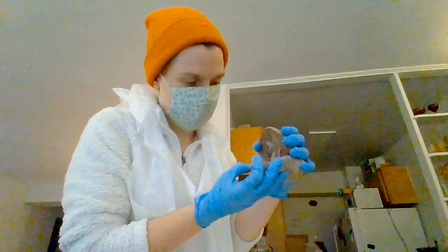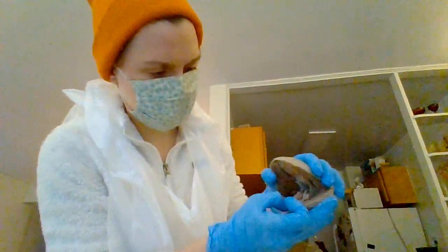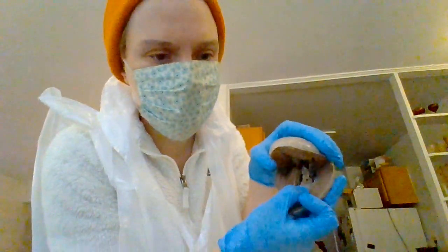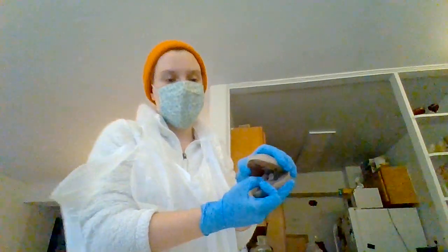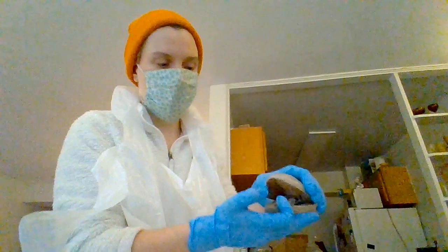And then we have the, I'll show you it here because I feel like you can see it better right there. The endocardium is what's on the inside, lining the inside of the heart chambers. Endocardium. I'm just going to flip my list because we've got two more to talk about.